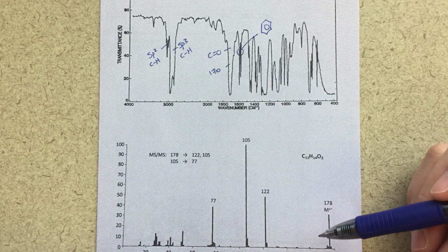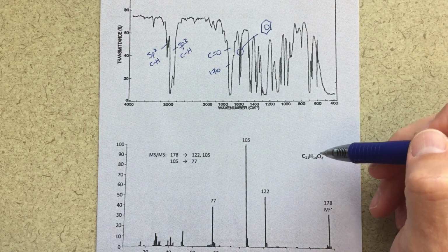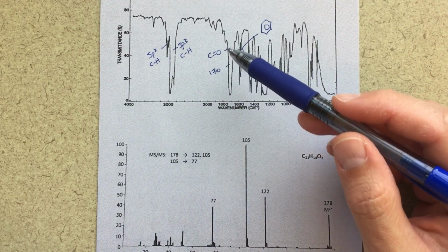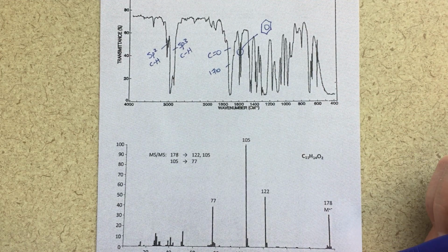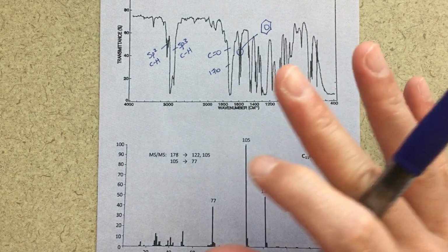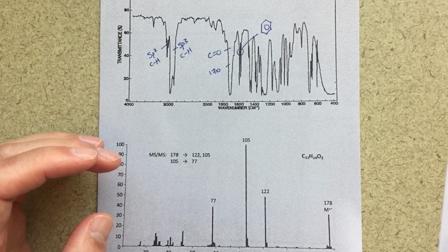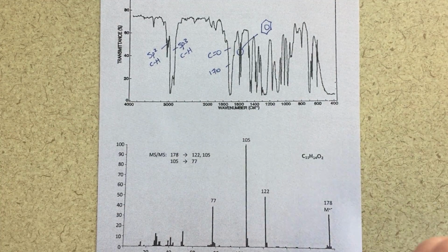So in my mind, the thing I'm thinking of at this point in time is an ester. If I have an ester, then that would give me my C=O. It would give me two sources of oxygen atoms. So that's what I've got in my mind at this point in time. But still preliminary, so we're not going to be drawing any conclusions yet. But I think having that in the back of our mind is a good thing to have.